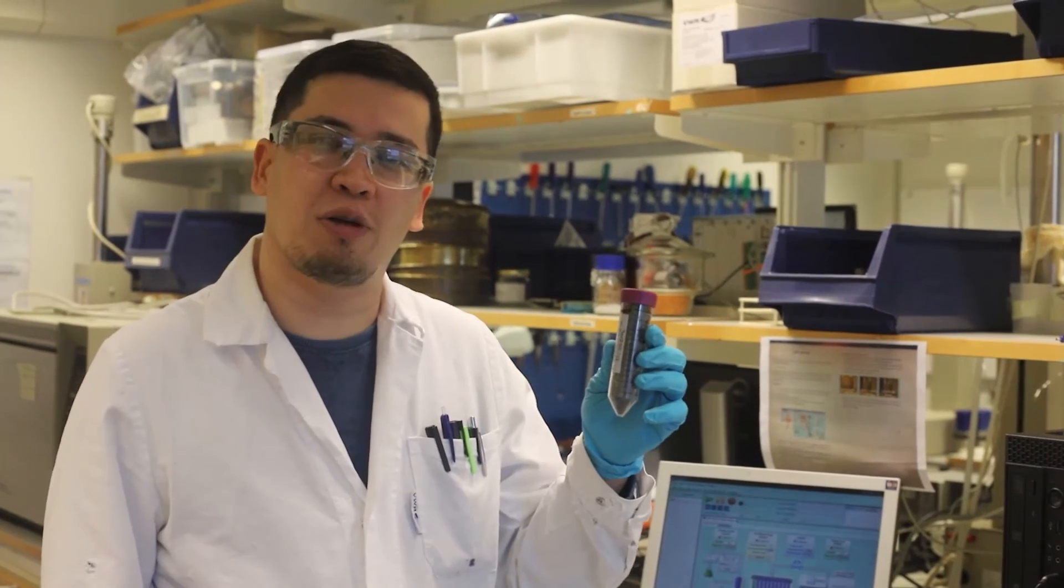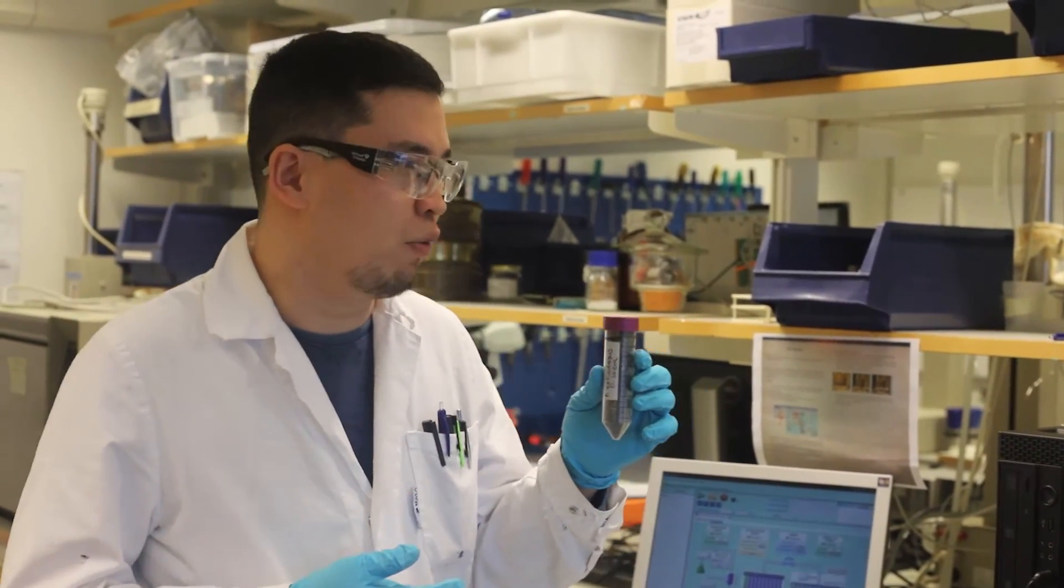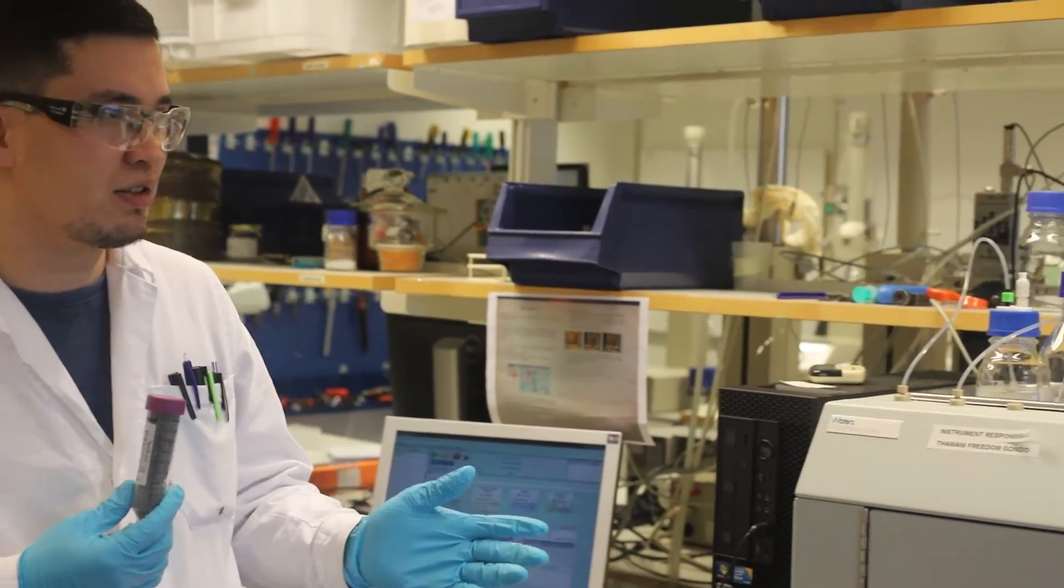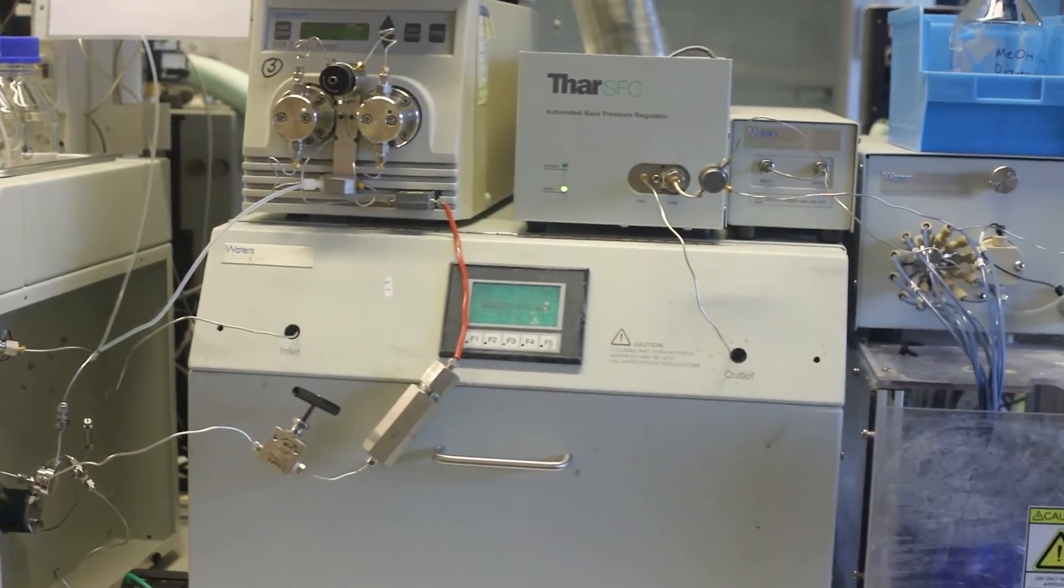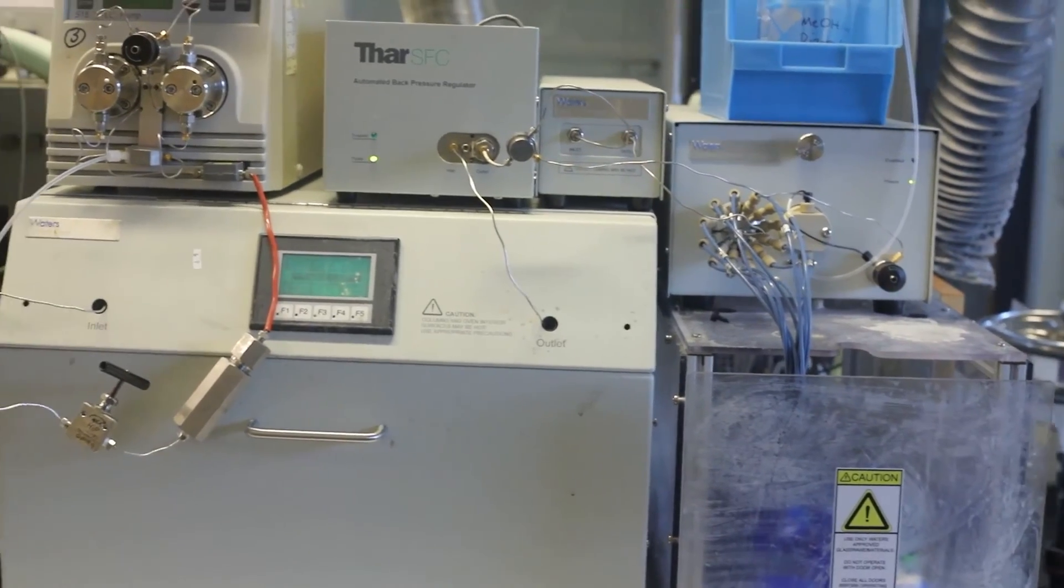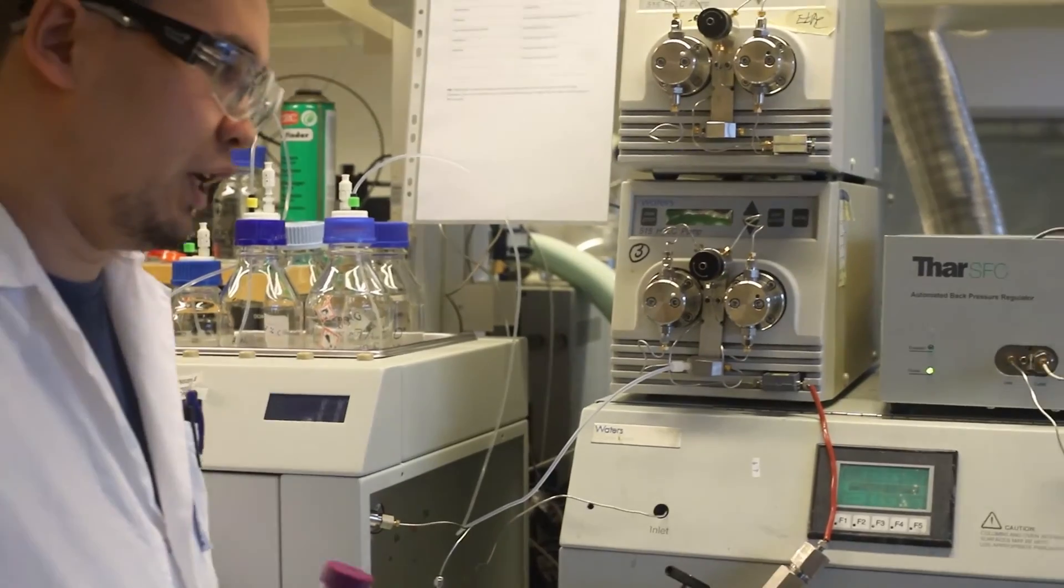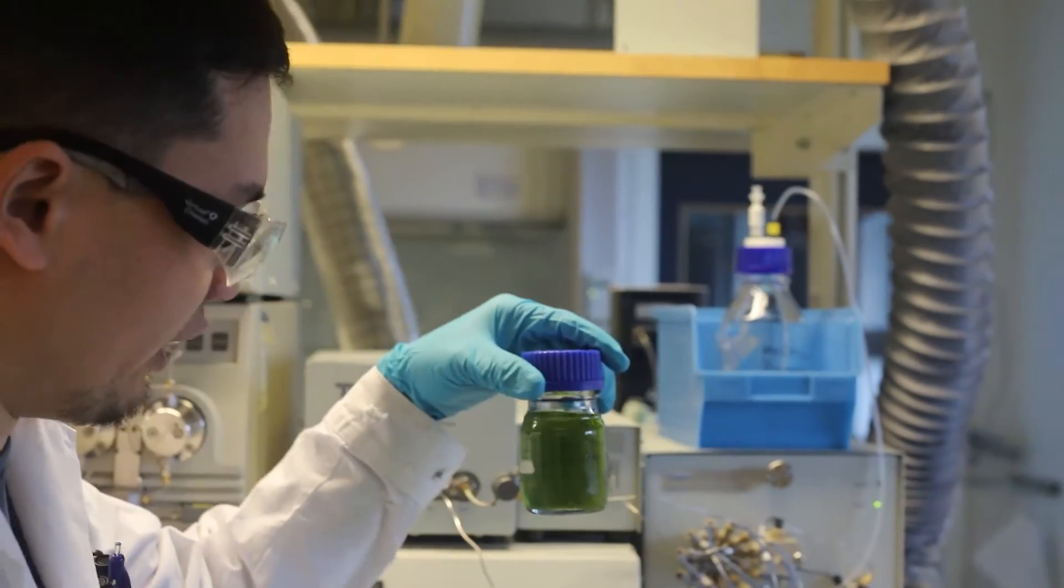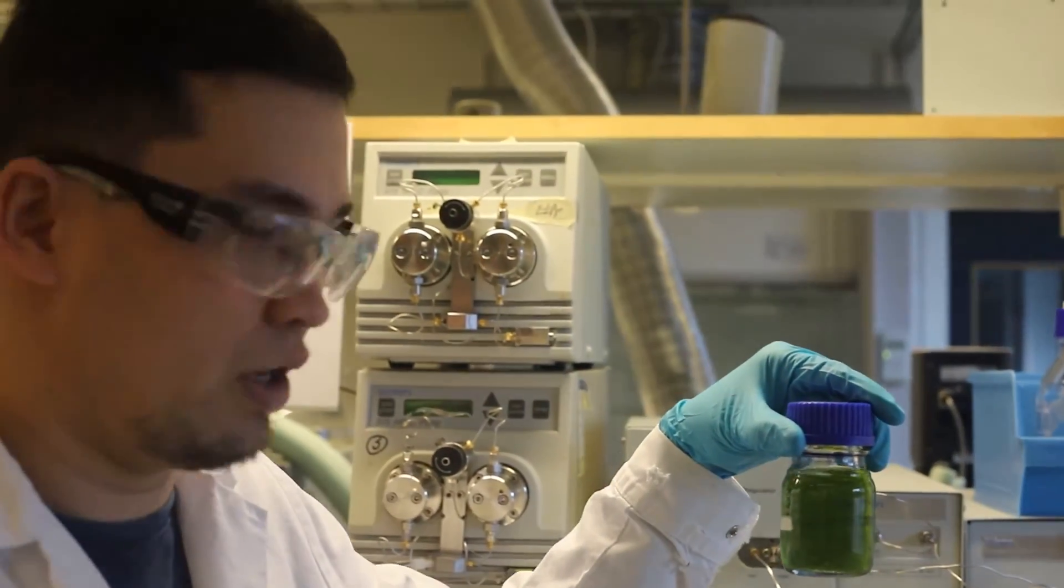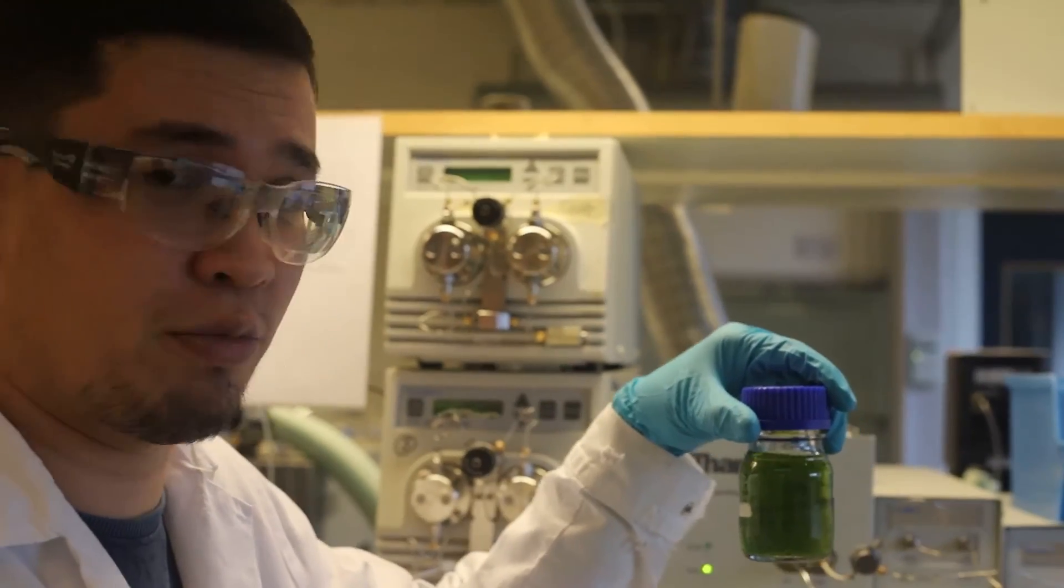And from this sample, I'm going to extract, like take some beneficial compounds out from these seaweeds, with the help of this instrument, as you can see, which is called SFE, Supercritical Fluid Extraction. And the result would be here, the collection of that compound, but still it needs to be processed further. So let's continue the process.